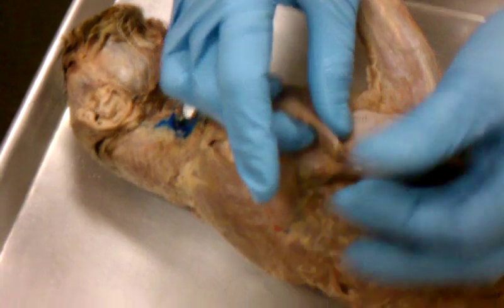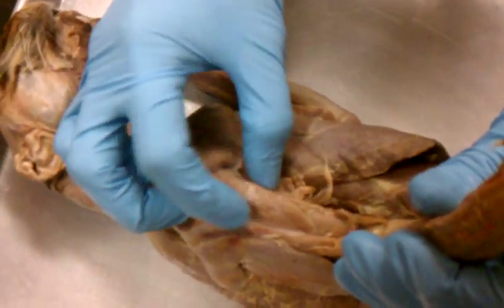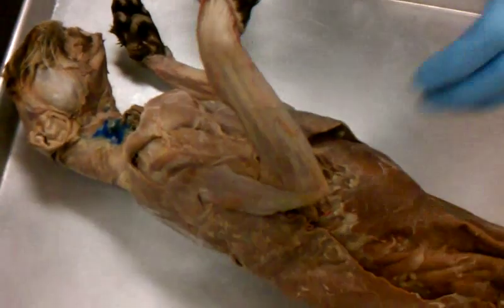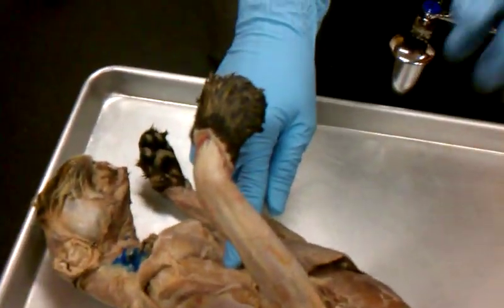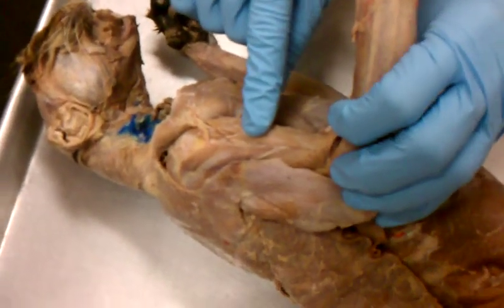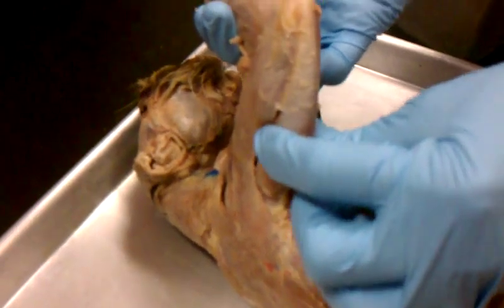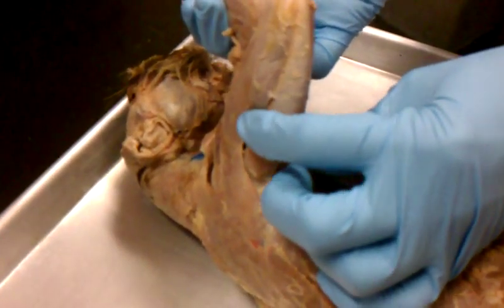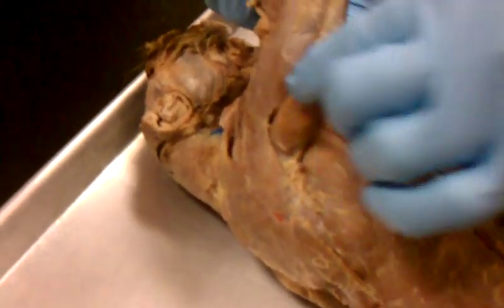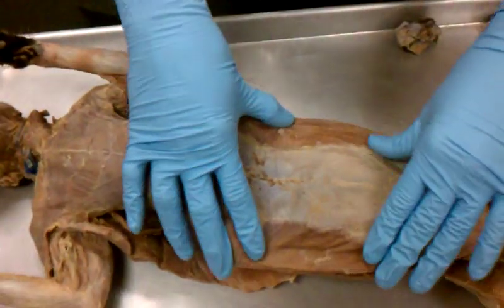They go over here. If you pull that back, you have the muscle with two heads on top of the arm. Remember what those are? Biceps femoris? No, biceps femoris is over the femur. Biceps brachii, because it's over the arm. On the bottom, this one is the triceps brachii, the one with three heads in the arm. Okay, and then you have all of your stomach muscles.